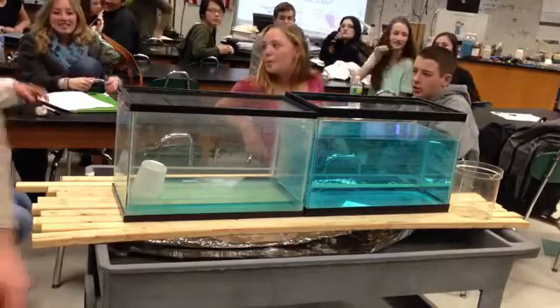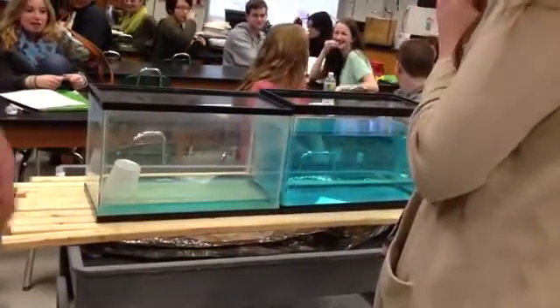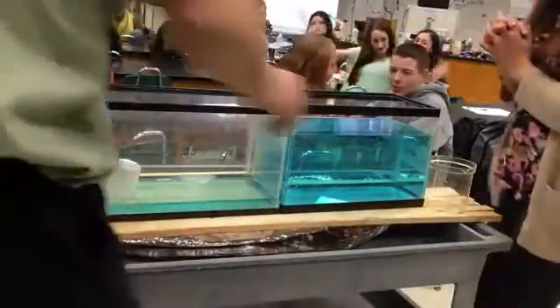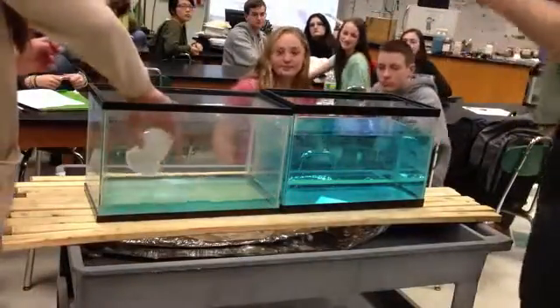Alright, so it's a little awkward because we're going to shoot from behind. I think we're okay this way. So we'll just stand on this side. Here's what we're going to do. Emma, you're going to sit over here and use that little cup, and I'm going to use this bigger cup.